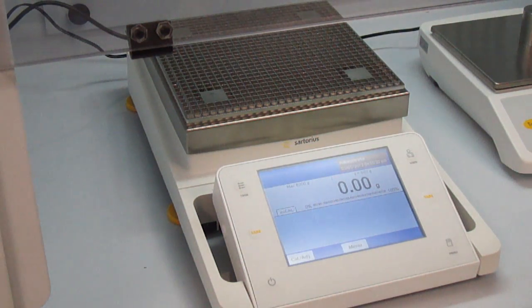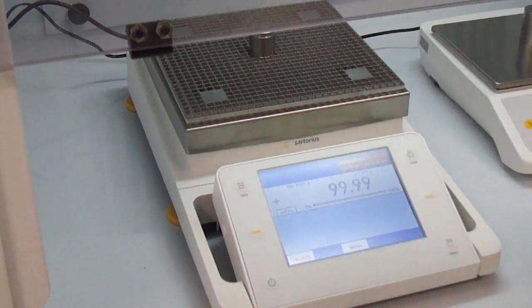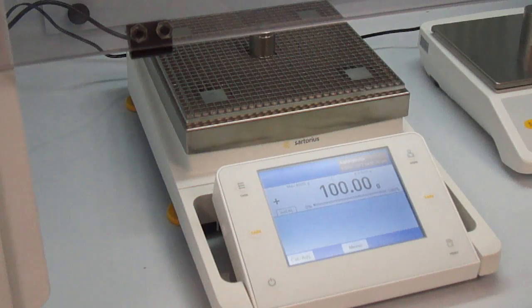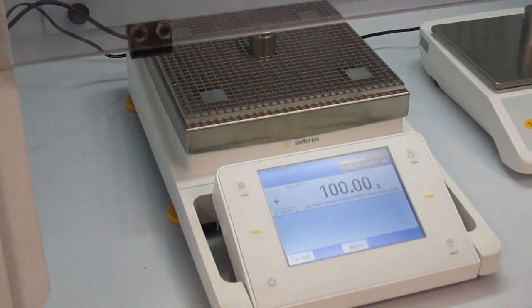Okay, now I'm going to put some weight on it. And you can see the difference between the stability now with the Q grid on.